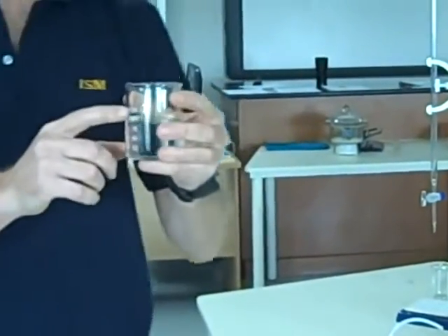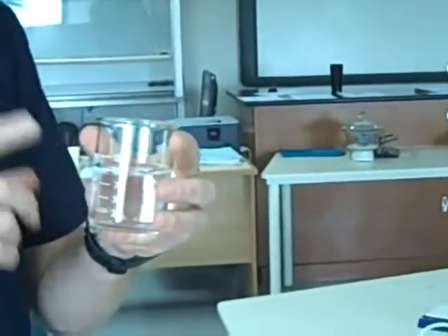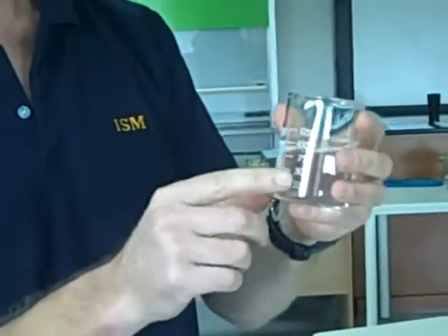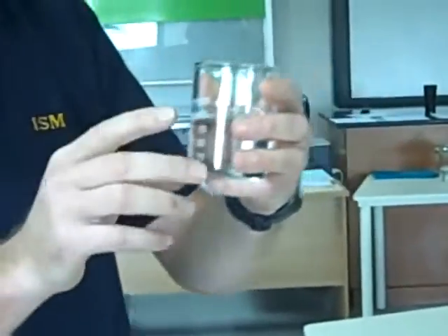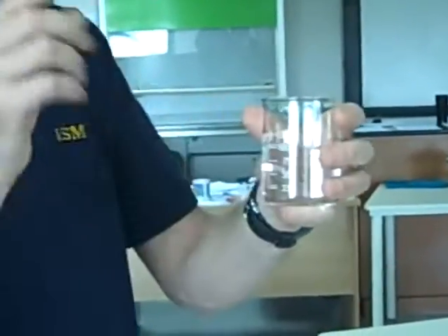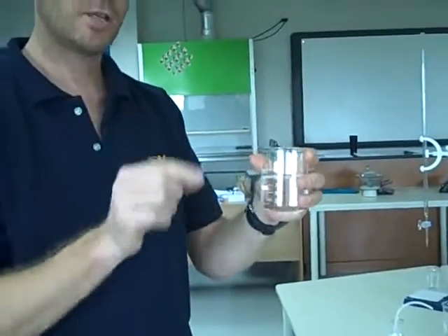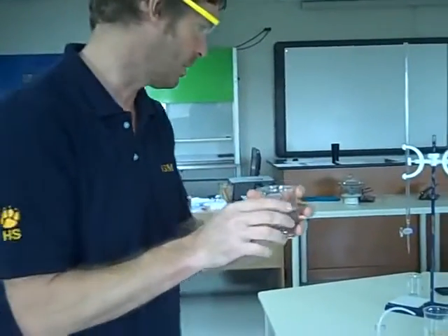This, by the way, should either be completely clean and dry. Excuse me, it needs to be completely clean and dry. It cannot be wet because otherwise we have then changed the concentration of the sodium hydroxide.